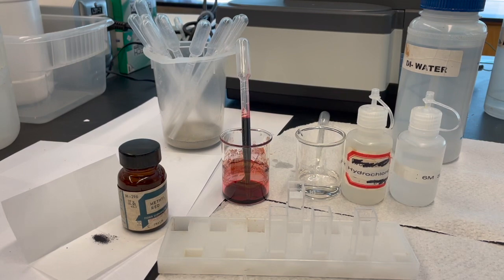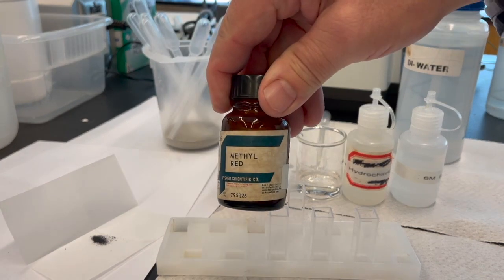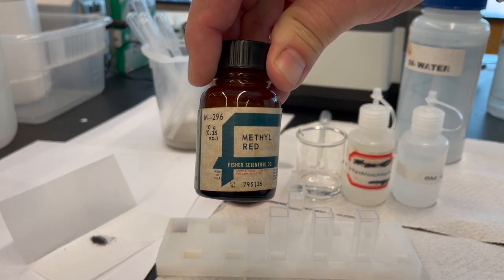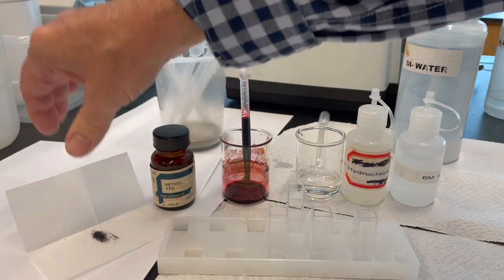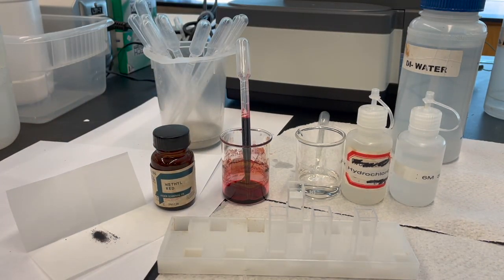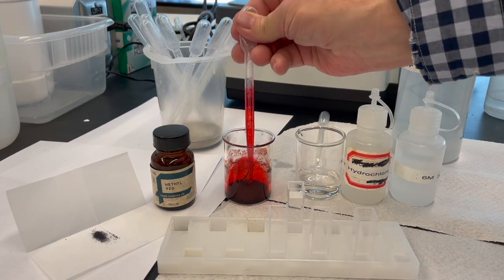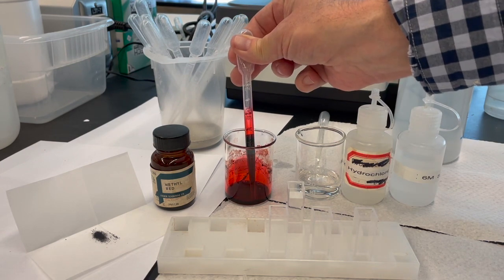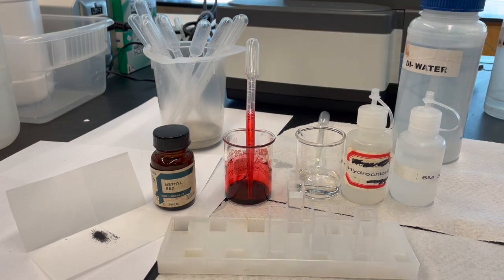I think I have everything here in the picture that you need. Here is the actual sample of methyl red. Methyl red looks like it was manufactured sometime in the early 70s, but it's still good. It is a near black solid. This next beaker is the 1% solution of methyl red, and you can see that even though it's only at 1% concentration, it's still tremendously highly colored.